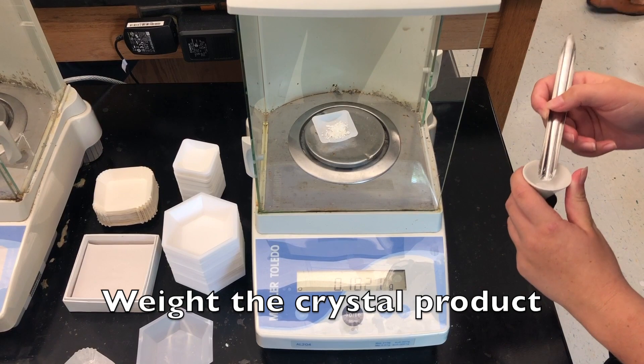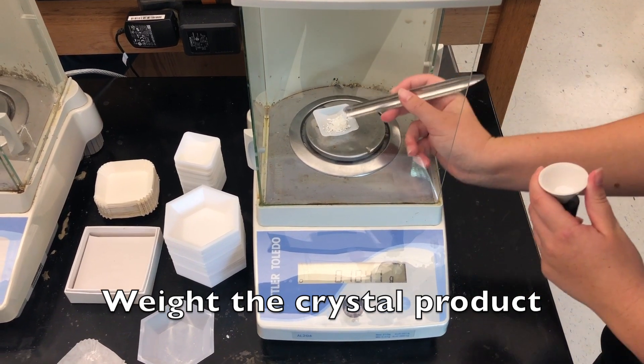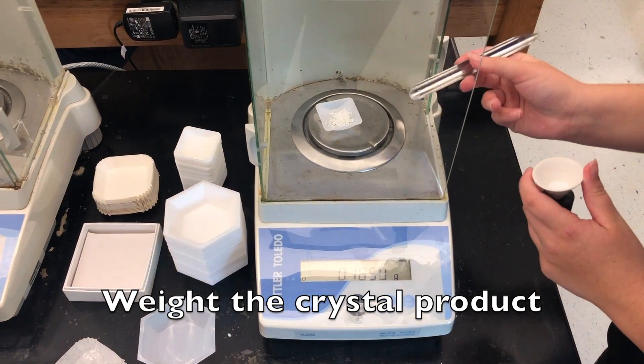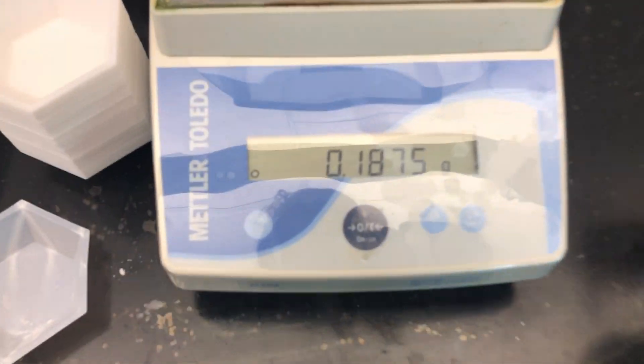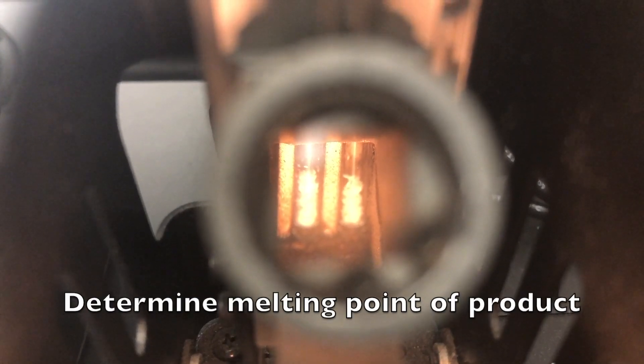Weigh the crystal product. Determine the melting point of the product.